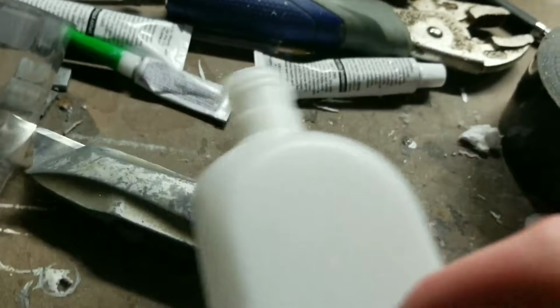So what I've done here is I put the pipe end in hot water from my coffee machine, and it softened up the pipe and shrunk it so that I could fit it in here. And now there's a nice tight fit. Not necessarily watertight, but we're going to fix that in a minute with Flex Seal. But before we do that, we're going to want to cut this pipe down to size. I'm going to use a hacksaw, but you could use any saw, really. Now that it is cut down to size with a box cutter, we could start gluing it.